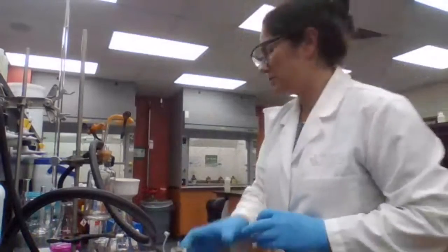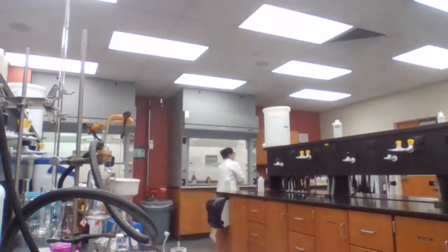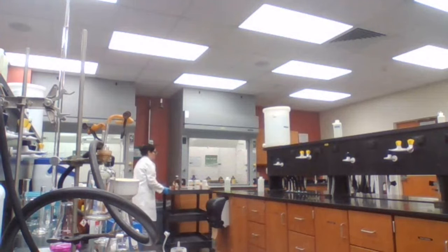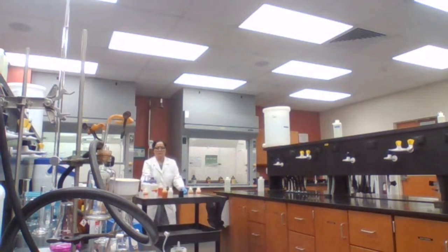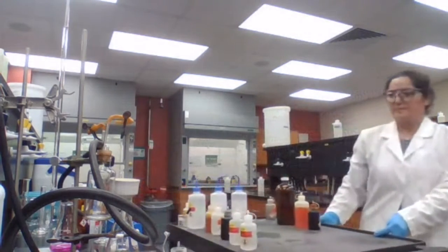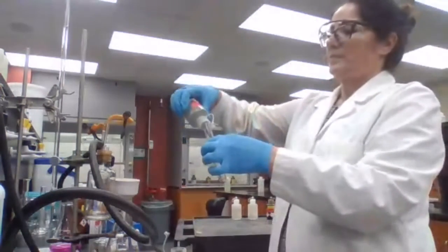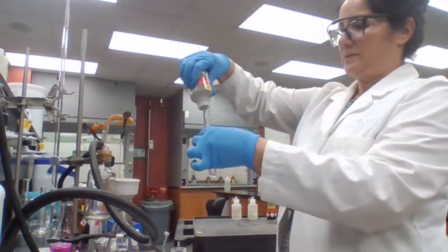This is ethanolic. About 40 drops or 2 milliliters.